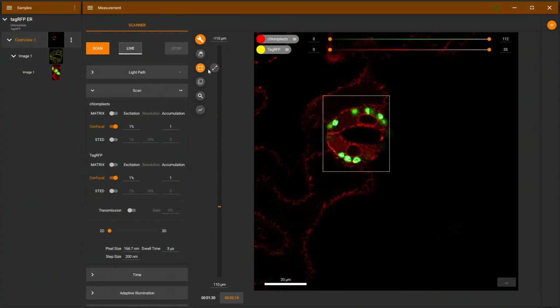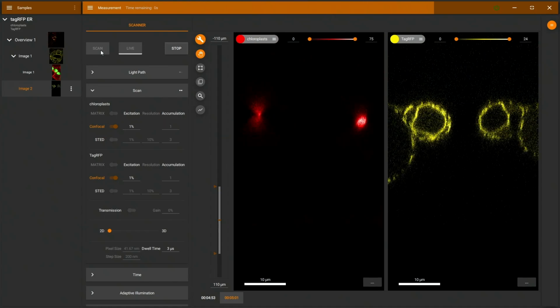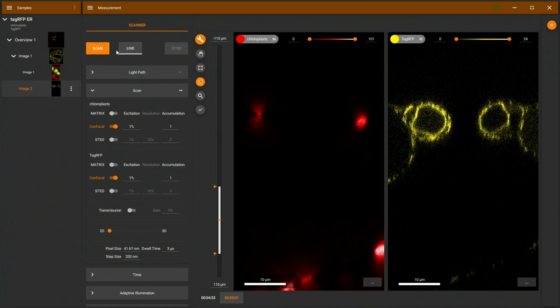I will go back to the overview and use a line ROI here. What does the line ROI tool do? We can now do a vertical slice through this structure. If I go to live mode, you can see now a vertical slice through the stoma. I'll adjust the Z range here with these two, and we can see now the image going further down. We see a few structures there as well.